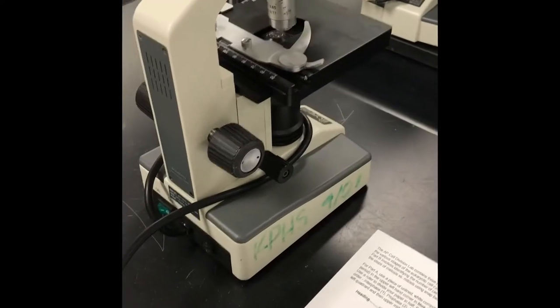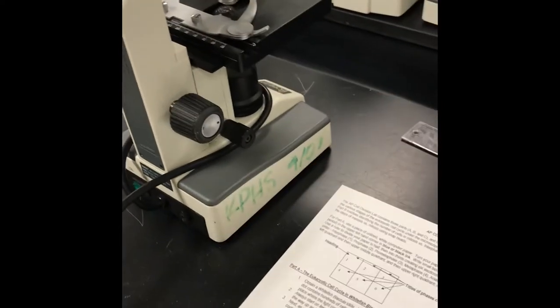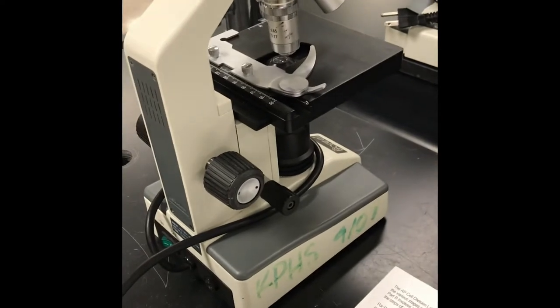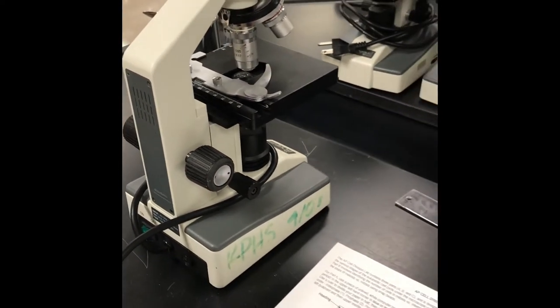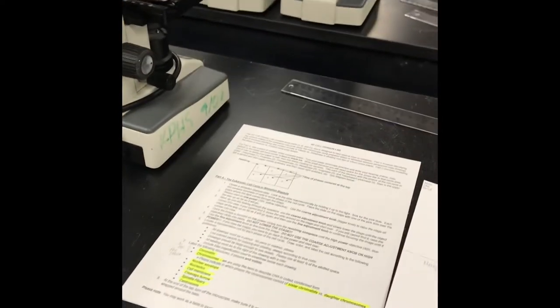So we're going to, for this lab, I want you guys to look. The kids that are in class are using the 40 to do the drawings. So you're going to have 400X magnification in which your drawings are finished on.